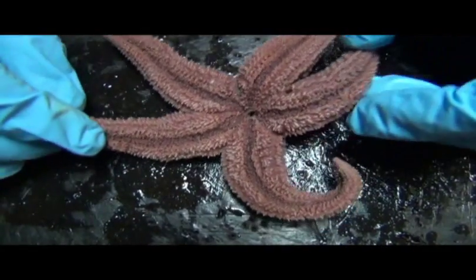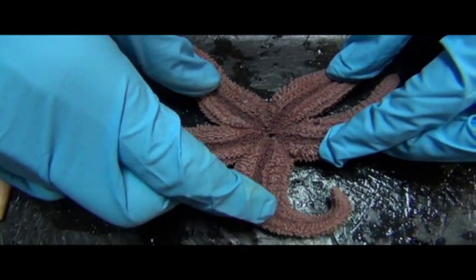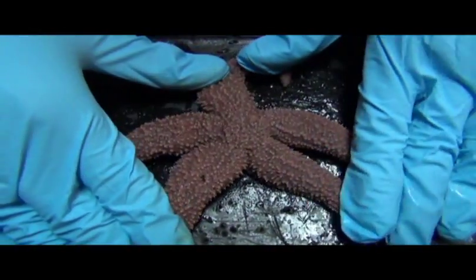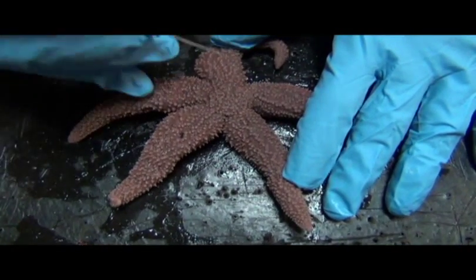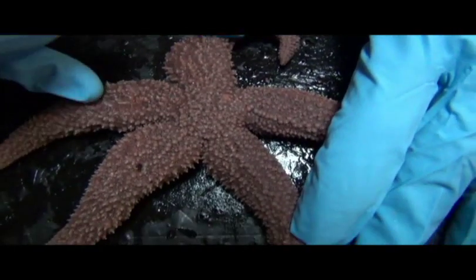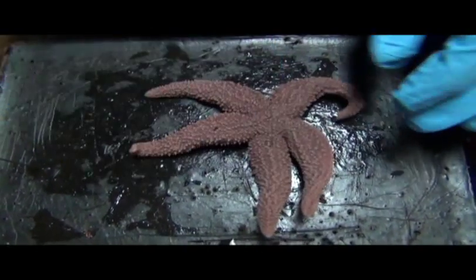That's pretty much the essentials of the externals. You have stomach beyond the mouth, and the tube feet, which have suckers on the tips. And so that's the major structures on the oral surface. On the back side, you have the aboral surface. In addition to all this armor out here, you have the madreporite, which is the main access point for water to get in and have access to the water vascular system that comprises its hydrostatic skeleton, which we'll go into now. Okay. So this is an intact specimen.